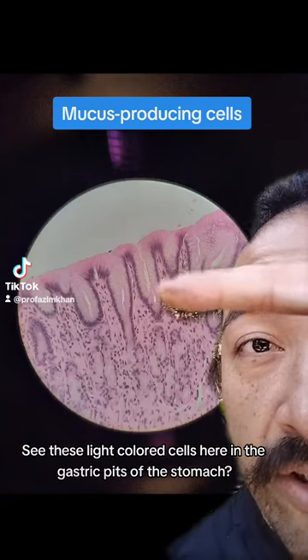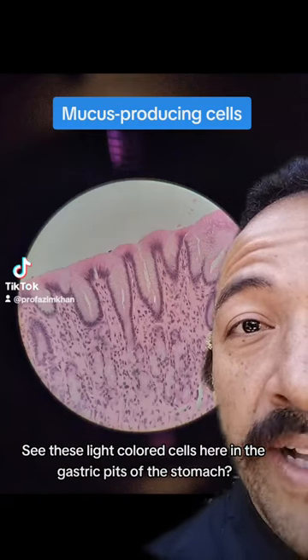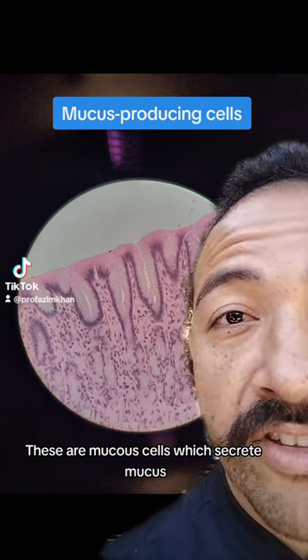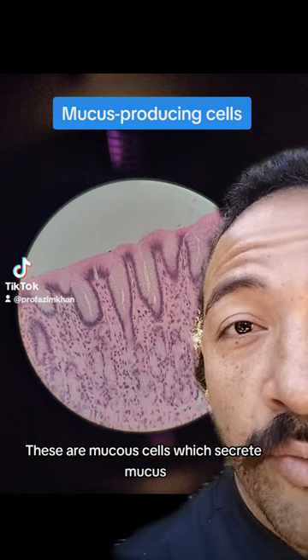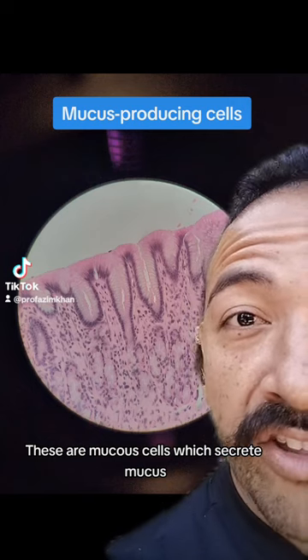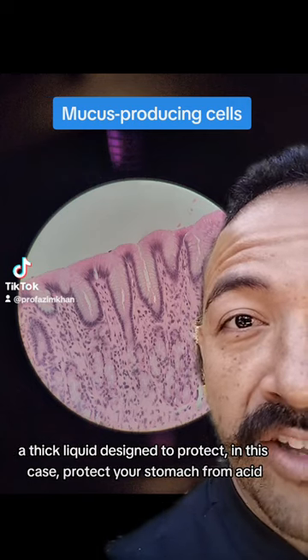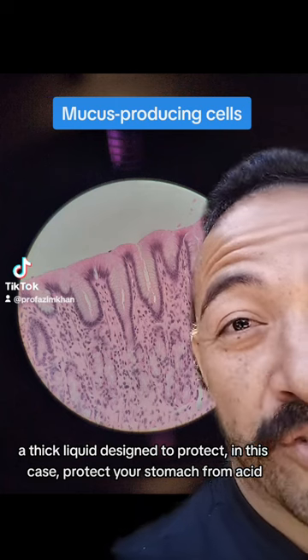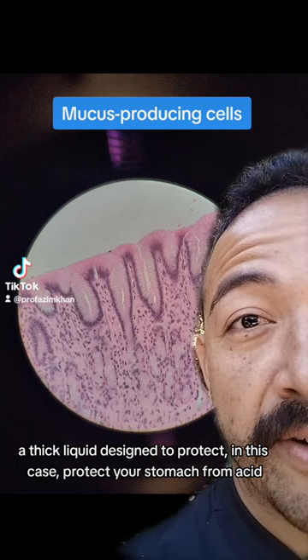See these light-colored cells here in the gastric pits of the stomach — these are mucus cells, which secrete mucus, a thick liquid designed to protect. In this case, to protect your stomach from acid.